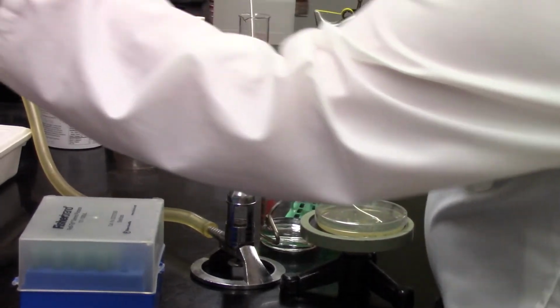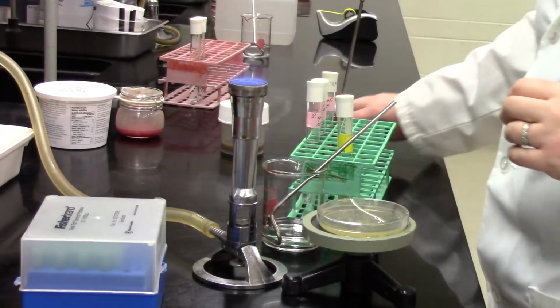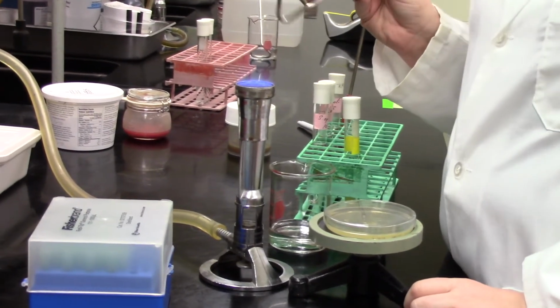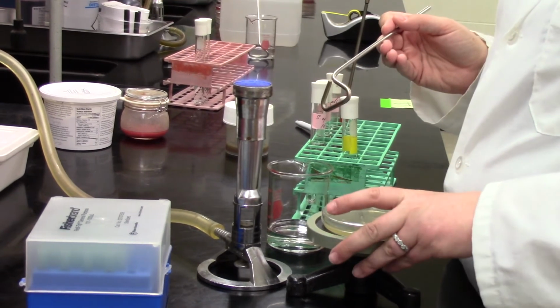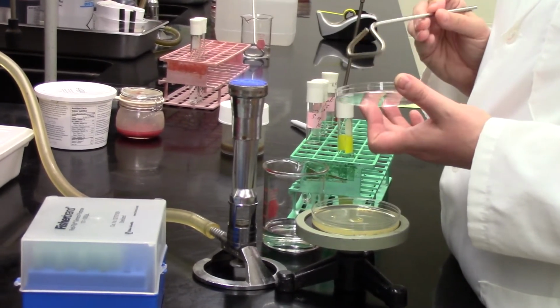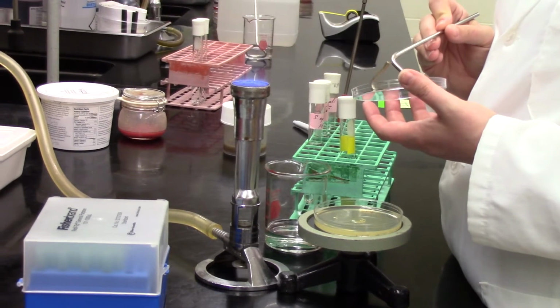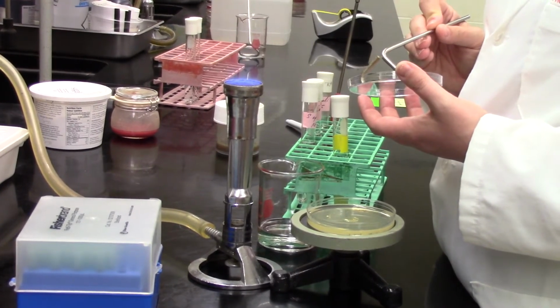And then we'll do some filming for you guys and we'll show you what the results look like and what type of bacteria. And then you can think about, how do those plates work? What's the selective part? What's the differential part? Given what we see on those plates, what are the most likely suspects in these food samples? And of course, comparing to what we see with the known bacteria, because that'll give us some hints too about what we might have in our food samples.